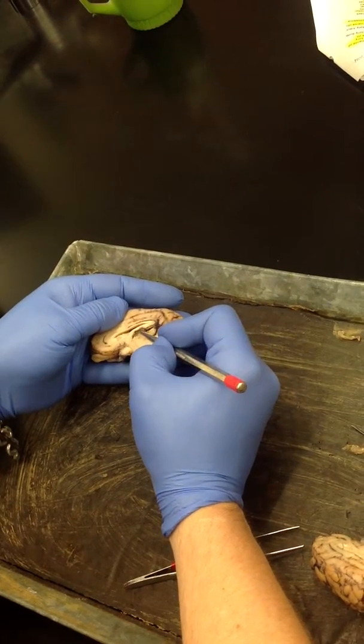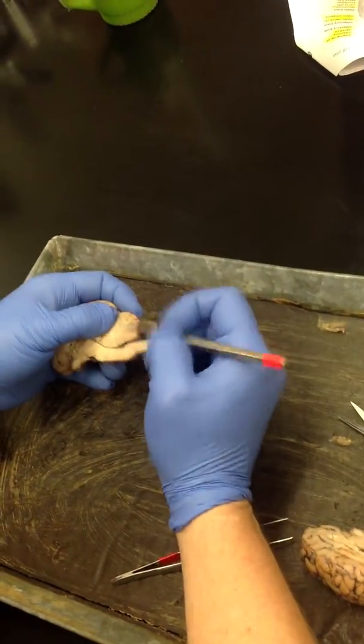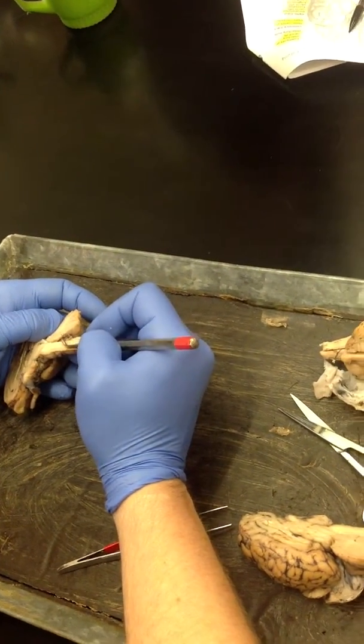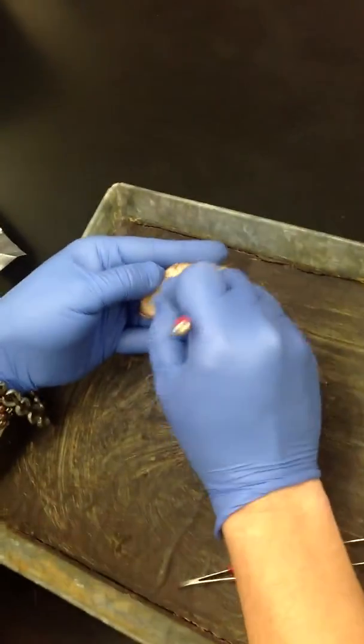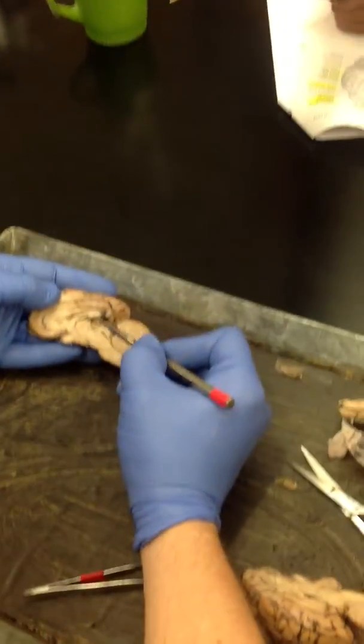This is the choroid plexus in the third ventricle, and you would actually even have it in the fourth. Usually you do, oh, no, there it is. You can see it there in the fourth ventricle as well. Okay, so it's in all the ventricles. So lateral ventricle is inside of here. Third ventricle is here along the midline.